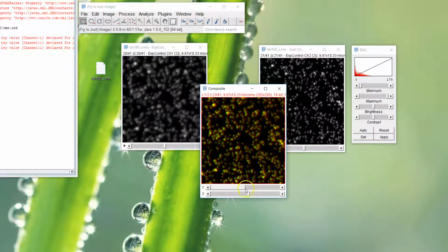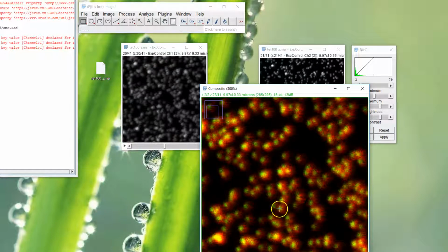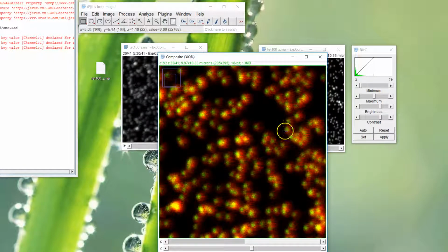This one's the red channel with a red box. I'm just going to bump it up a little bit there. This is the green channel, and so we use plus and zoom in. You can see the spots are smaller from the confocal, the STED versus the confocal. These aren't properly aligned. We were in the process of demonstrating the alignment to me, so this was kind of as we were playing with the system and checking the alignment.